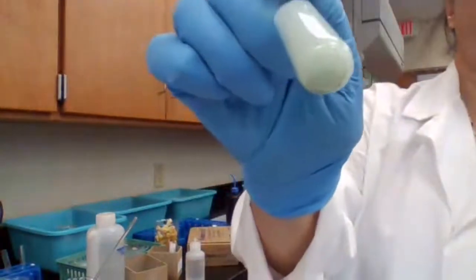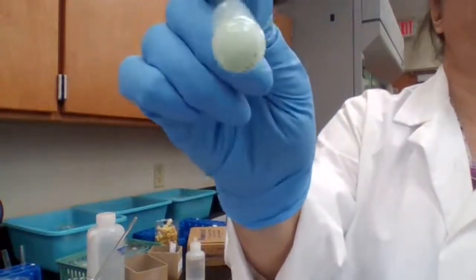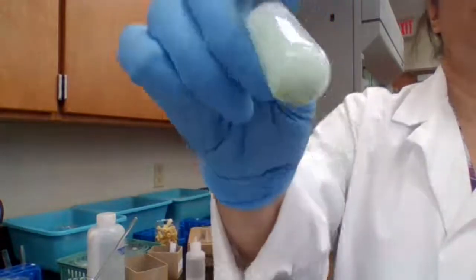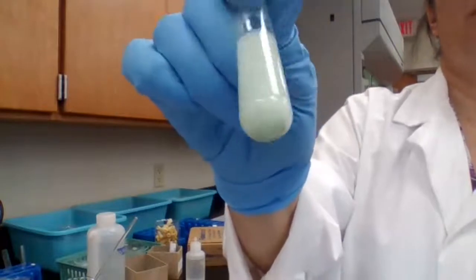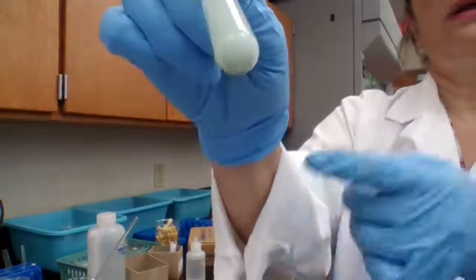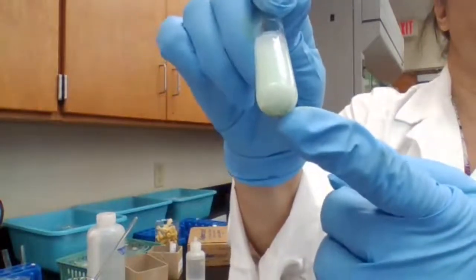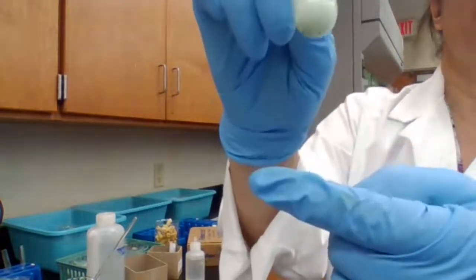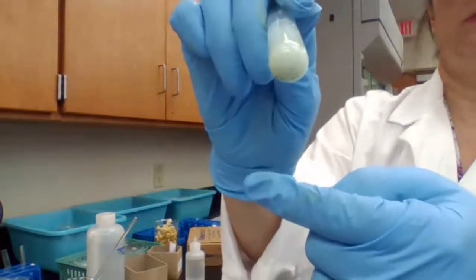You see those black particles in there? Those black particles are bismuth. So if you have the black particles, that means bismuth is present. The black particles with the white precipitate you have can give you a gray color, but this is the evidence. If you see even 2 or 3 of them, but I see a lot right now, that is evidence for the presence of bismuth. So make sure you record it.